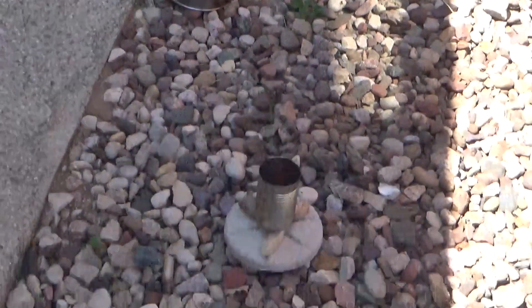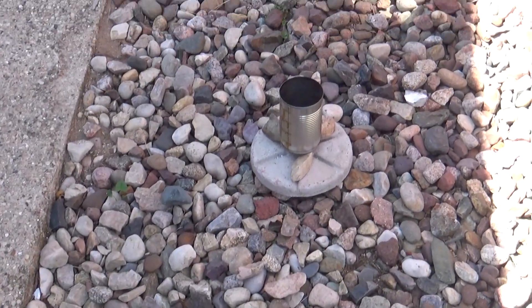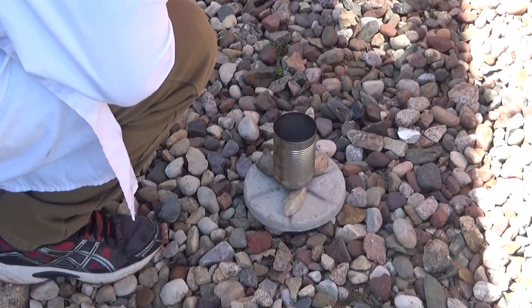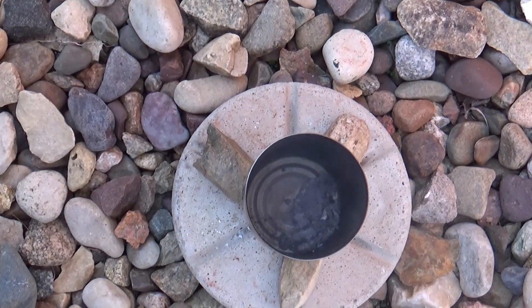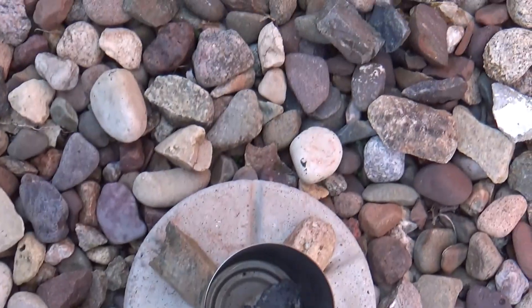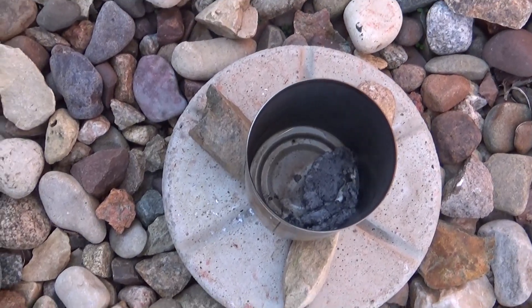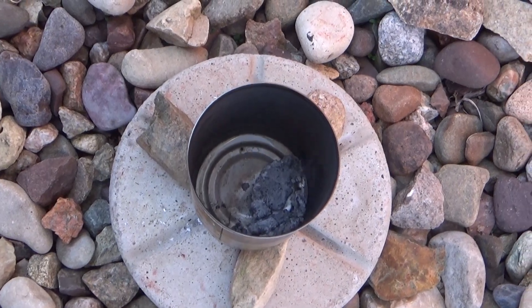I don't know how long it's been — just a few minutes. I'll just go until it stops reacting. More sodium's reacting. I don't know if you can see that — it's sparkling a bit. When it does that, that means it's reacting. I think I just missed it, but it was sparkling a little bit.